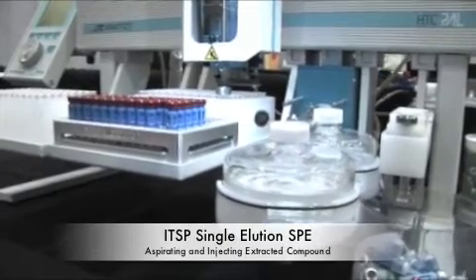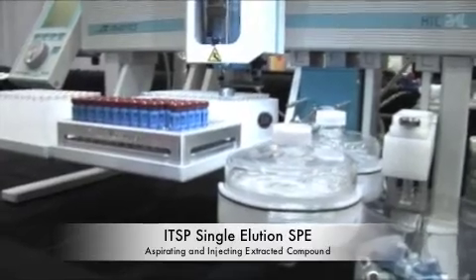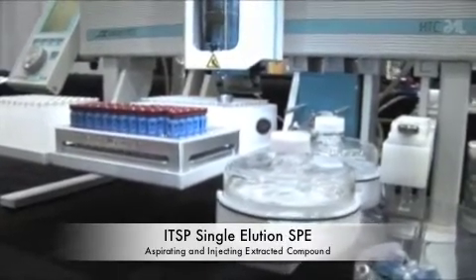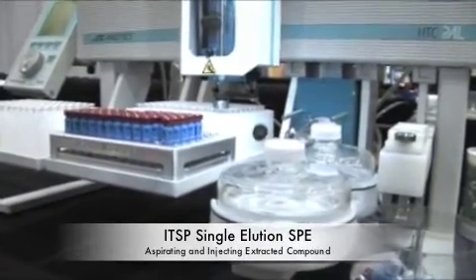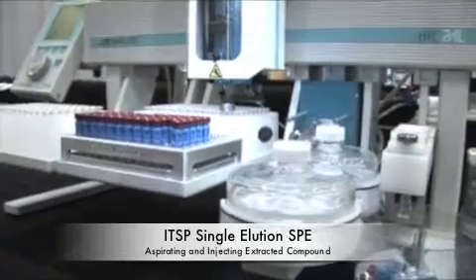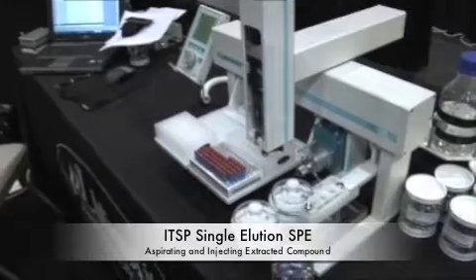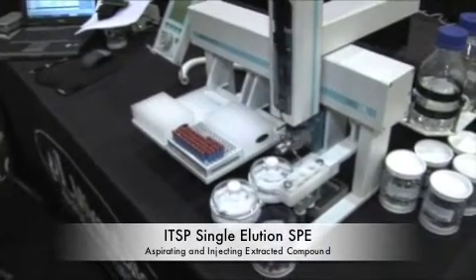So what you saw there was we actually did the elution into that well. We discarded the device because you no longer need it, and it will pick up and inject right onto the valve. So the idea is to be able to elute onto the valve or inject onto the valve, and then within the analytical runtime of the instrument, we are actually prepping the next sample. It is serial, but there is no downtime basically except for the first sample prep. And there's the final injection.